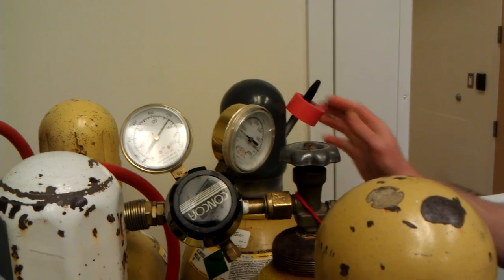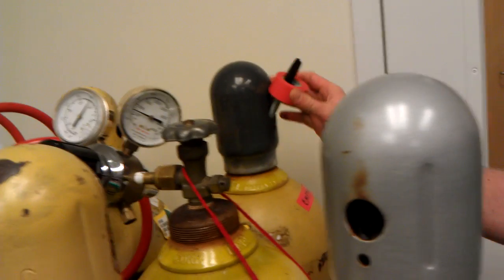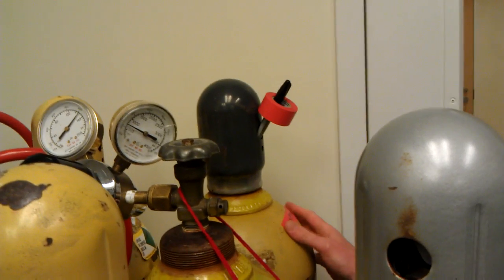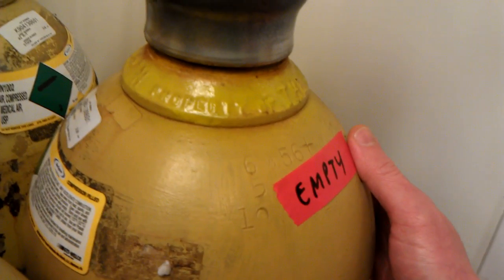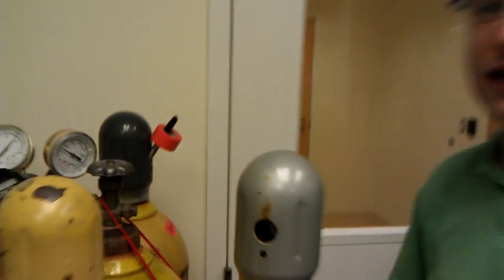If the tank is empty, please label it with this red tape and the marker, just like this here is empty, so we can make sure that there are tanks for everyone to use. Thanks a lot. If you need any help, just contact me.